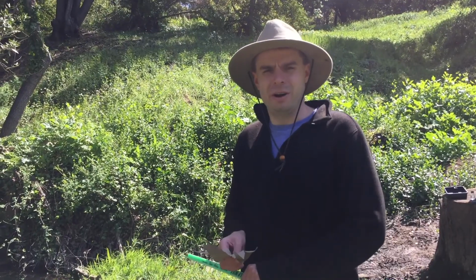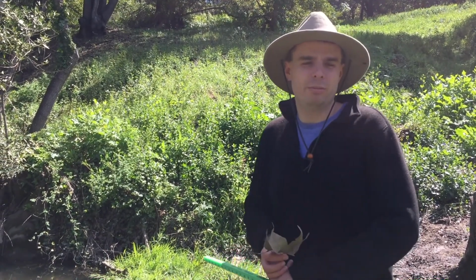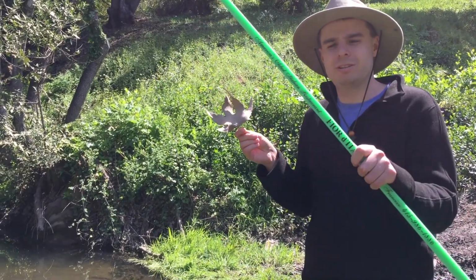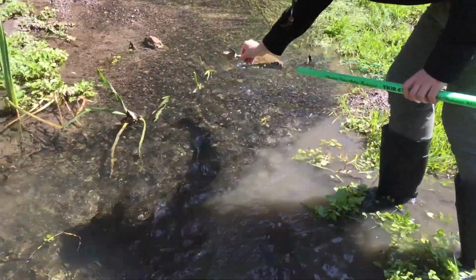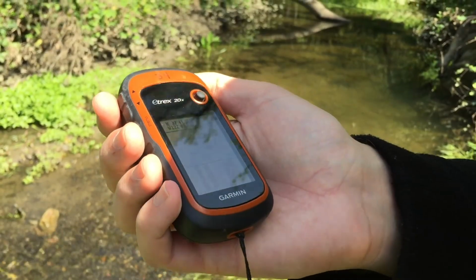For the second part of measuring discharge, I use one of two ways. One, you use a flow probe, or if you want to do something quick, and if you're lazy, you just get a dry leaf, a measuring stick, and a timer, toss the leaf into the creek, measure how long it takes to go by, and there you have it. I almost forgot one very important thing. Gotta take GPS coordinates. There's our GPS. So if you all want to do this again, here's the location we did it at.